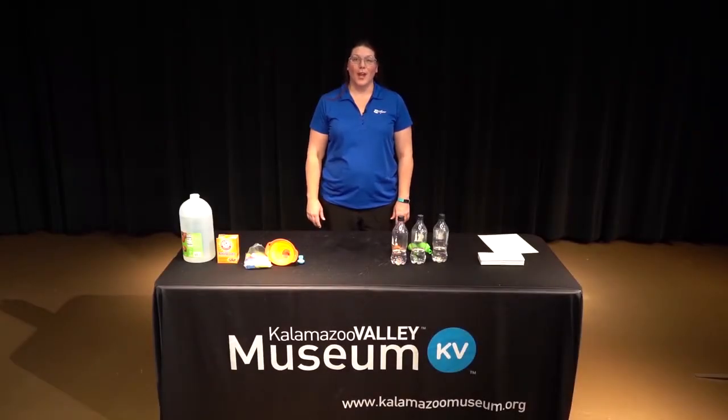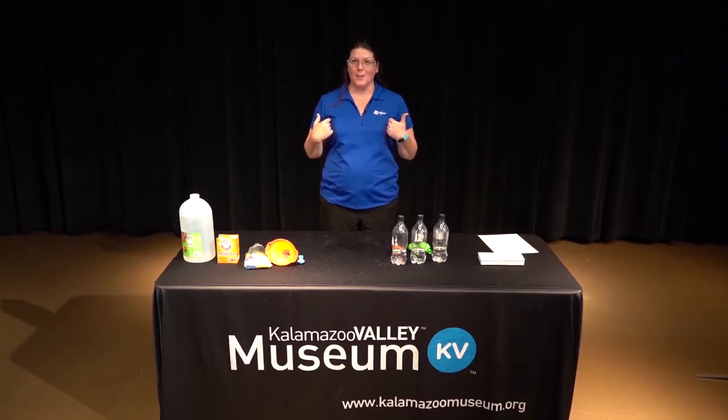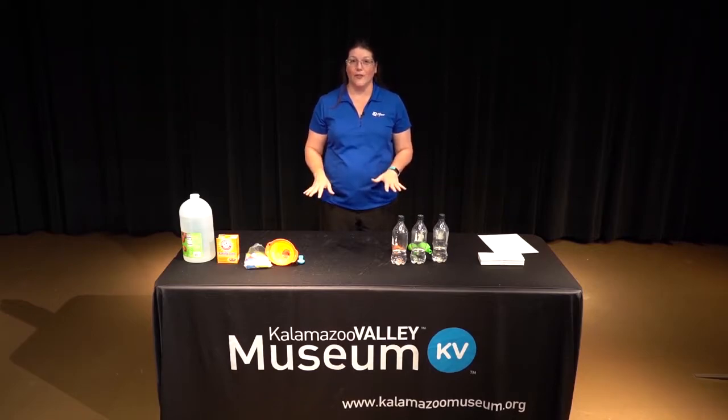Hello, I'm Renee Bull. I work at Pfizer in Kalamazoo. My colleague Matt told you earlier all about acids and bases and how those reactions happen. Well, he let the gas go way up into the air. I'm going to trap it with my demonstration because we can't see gas very well, but this will show us that the gas is there from our acid and base reaction.